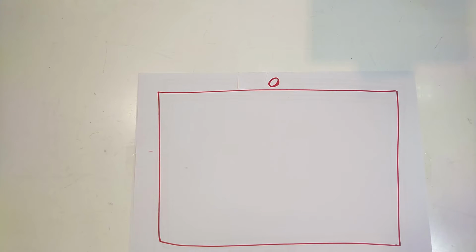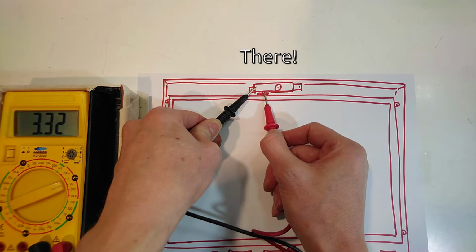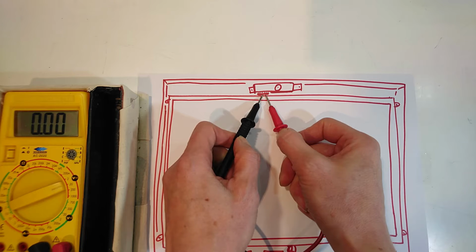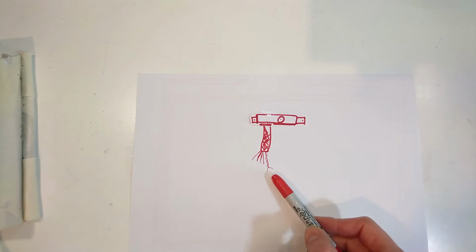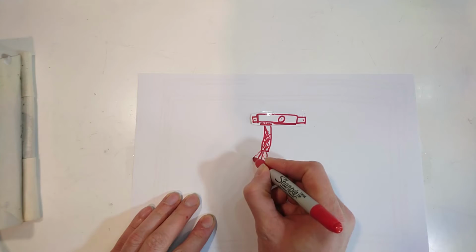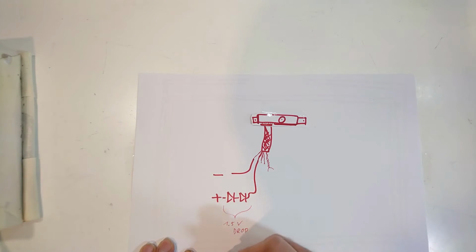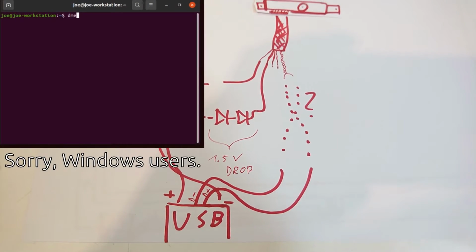If the laptop still works, switch the camera on, remove the display frame, and then measure which connection is about 3.3 or 5 volt relative to ground. Then find the ground wire itself. Remove the camera module and find the two twisted wires, which are most likely USB data plus and minus. If the voltage you measured was 3.3 volt, you have to place two diodes in series with the USB 5 volts, or otherwise the camera might get damaged. Then try out which data line is which. You cannot really break anything here. If you did everything right, the camera should become visible as a USB device when connected.